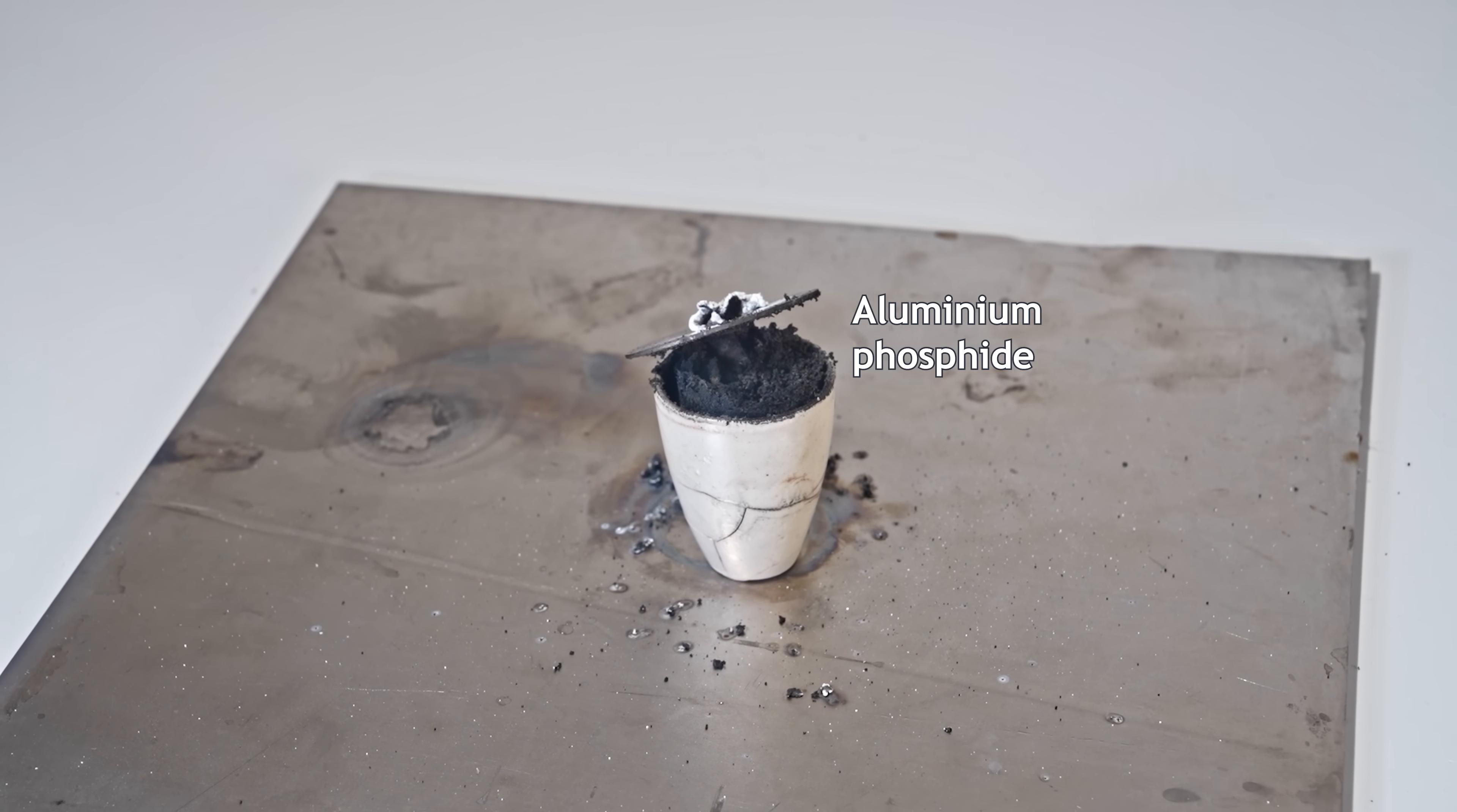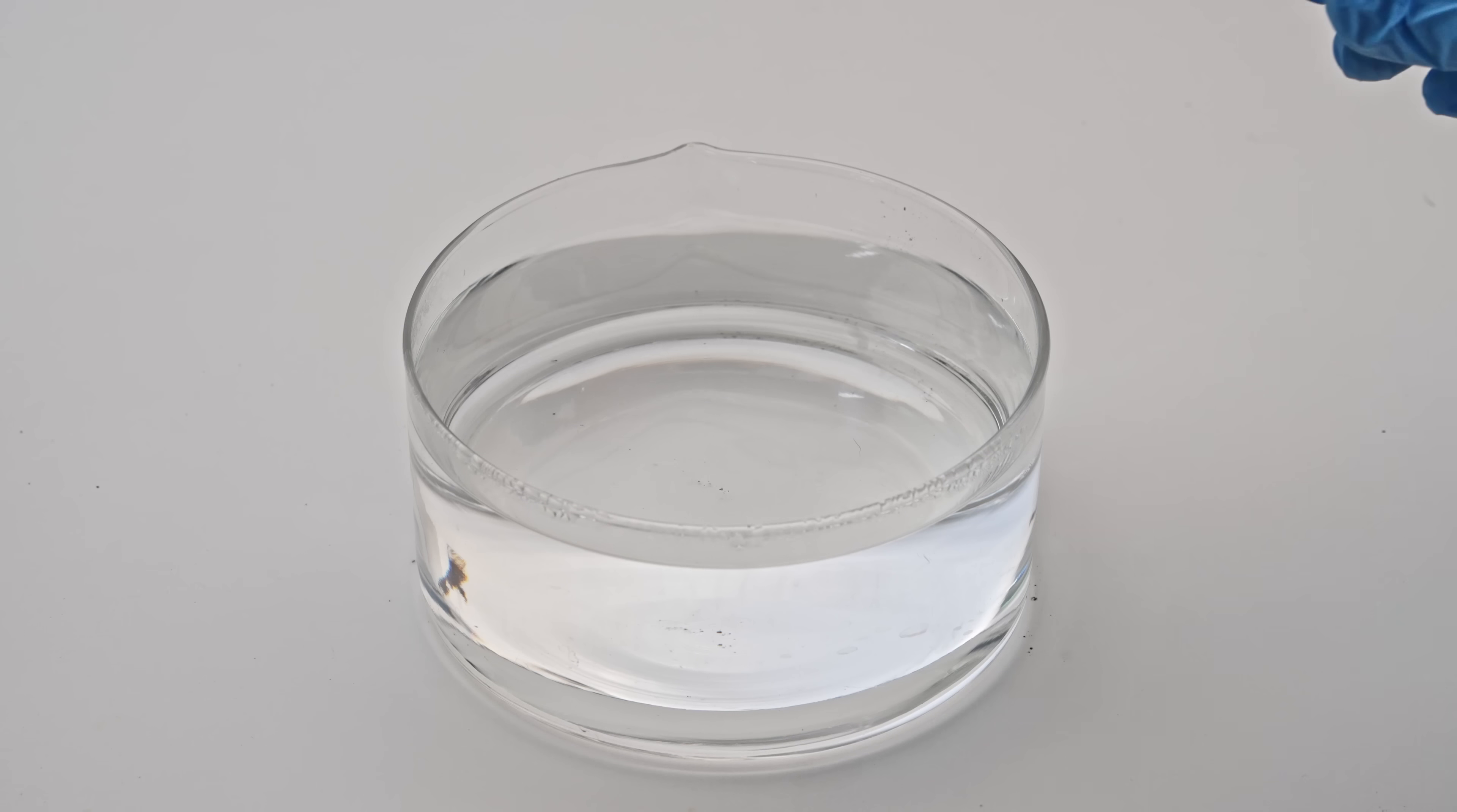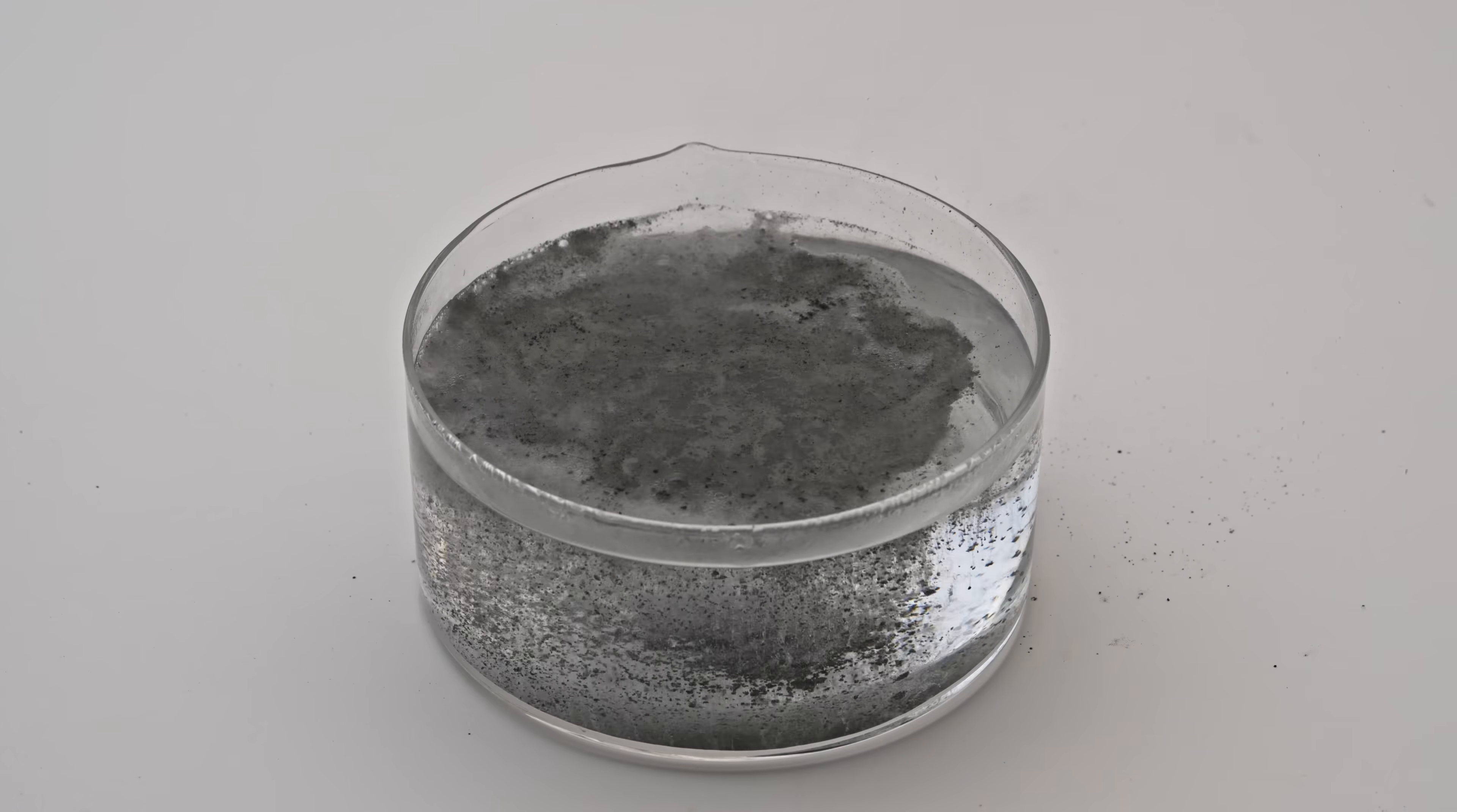Phosphine is extremely flammable. Since this reaction doesn't produce diphosphine, the compound that spontaneously ignites in air like it does in the magnesium phosphide reaction, everything stays calm for now.